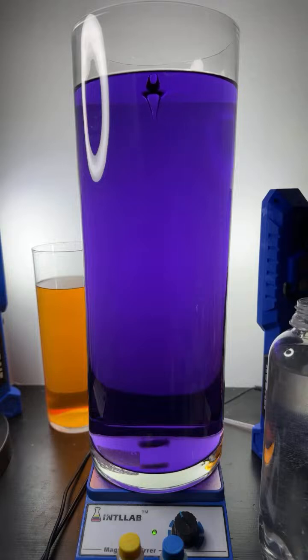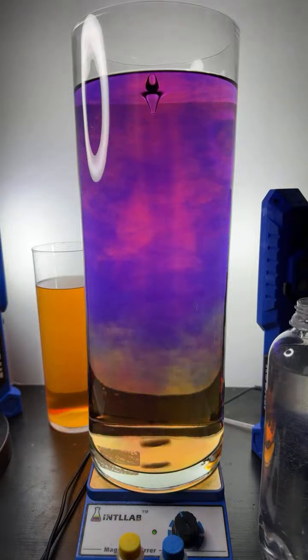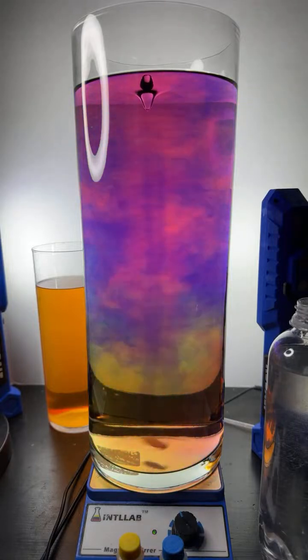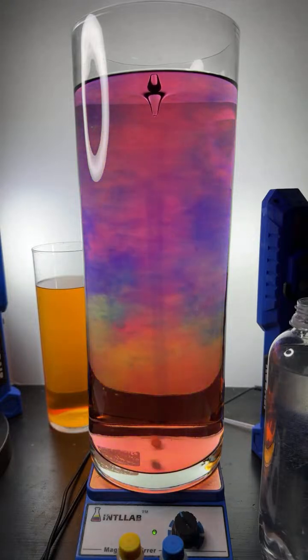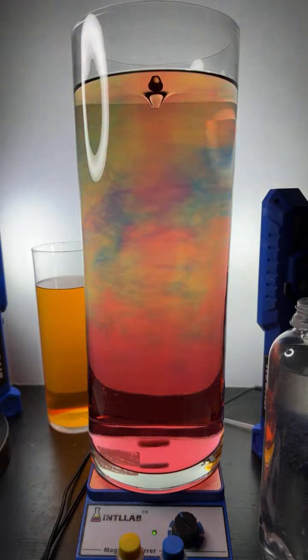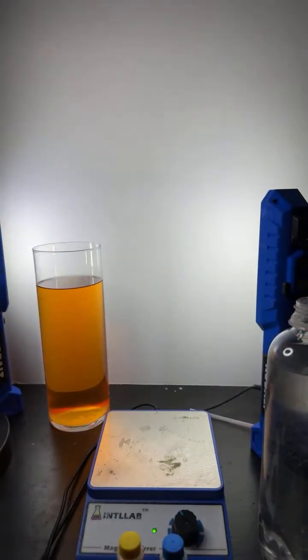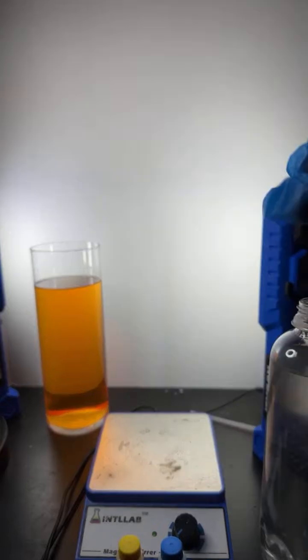Here, let me make it acidic first. I always usually make it acidic when I store it. And we may come back to this. All right, a bunch of acid in there. Let's see what happens as that moves through. Gorgeous. Gorgeous color changing. Very nice. Okay, I've acidified that. Oh, that's big. Man, is that big. Okay. We'll turn this off. Thank you there, Shrey.